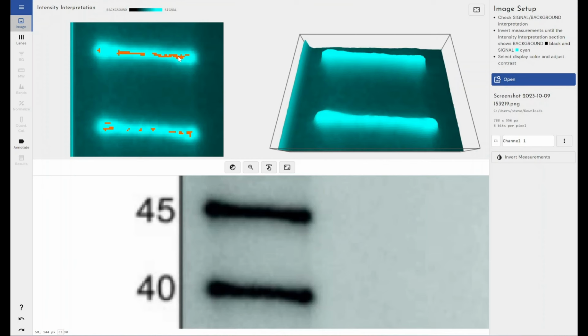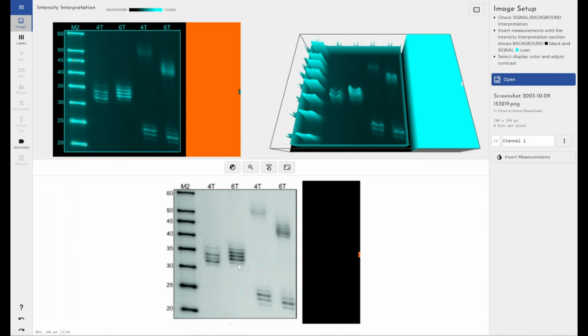If your marker bands are overexposed, that's fine because we're not quantifying those, we're just using those as, in this case, a nucleotide marker. If they were part of my bands for my samples that I was wanting to quantify, that would mean that I can't accurately quantify those bands because essentially the value could be much higher than the value I'm seeing. I've just reached the limit of what I can measure. So if you were to run into that, the easiest fix would be to expose your membrane for less time, not have an overexposed membrane, to try and bring that down.